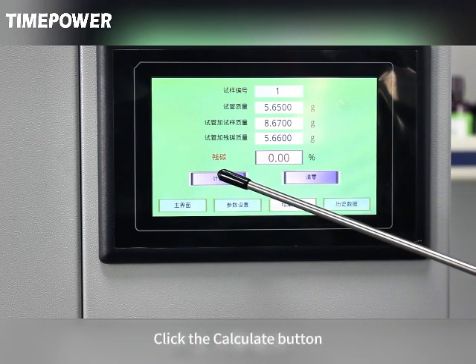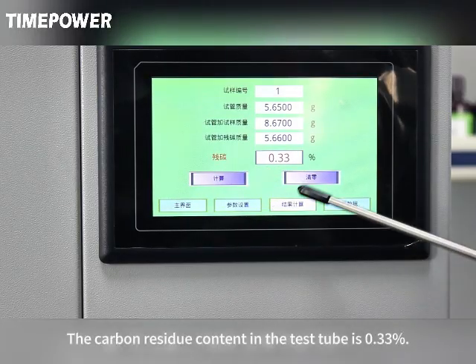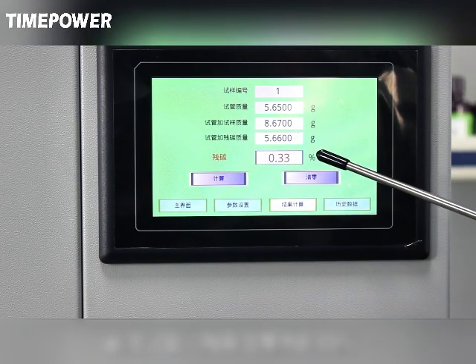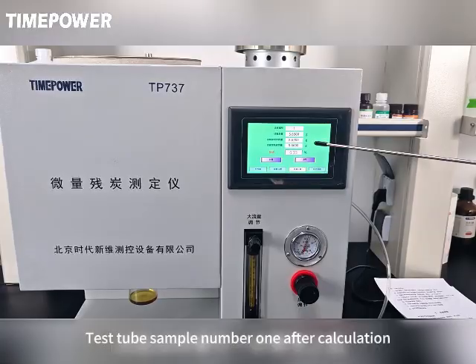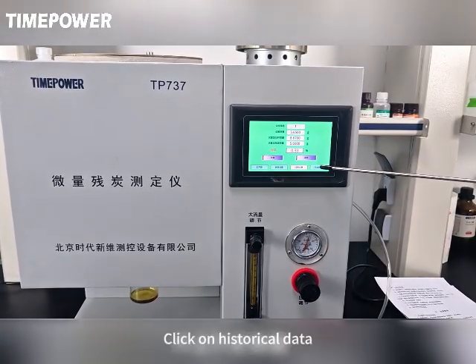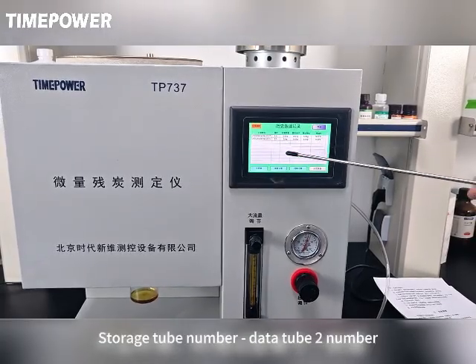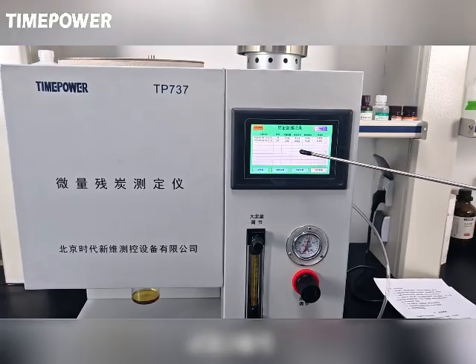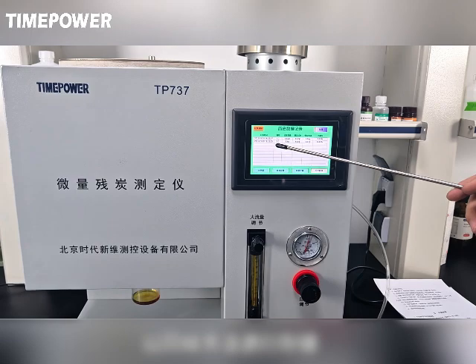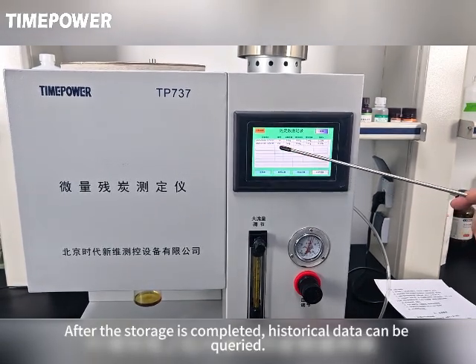Click the Calculate button to calculate the carbon residue value. The carbon residue content in the test tube sample number 1 after calculation is 0.33%. Click on Historical Data, then click Store. Store the tube number and data. Store in the same way. After the storage is completed, historical data can be queried.